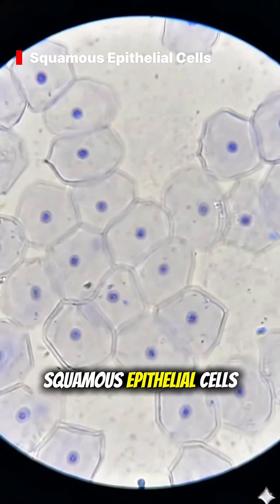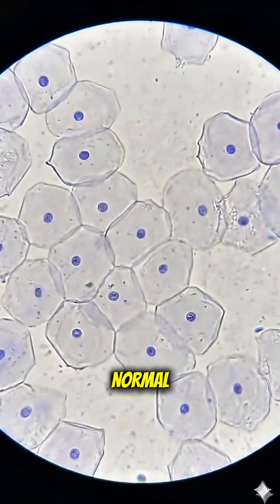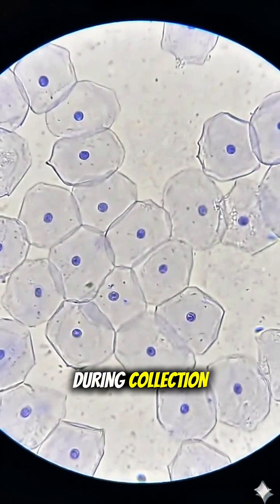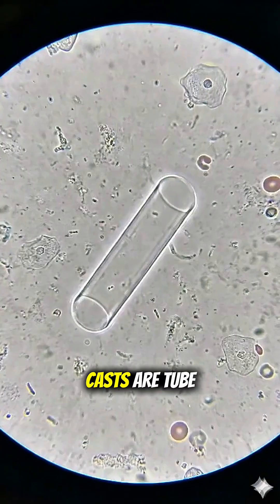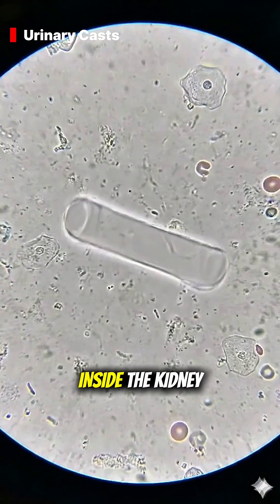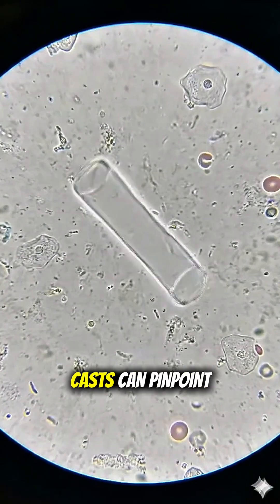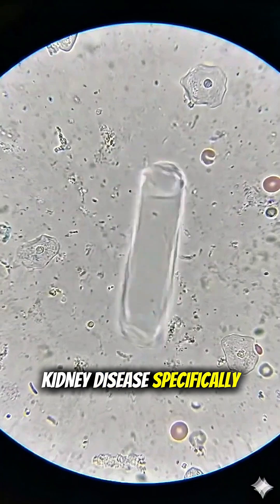Squamous epithelial cells — a few are normal, but too many usually indicate the sample was contaminated during collection. Casts are tube-shaped proteins formed inside the kidney tubules. Granular or cellular casts can pinpoint kidney disease specifically.